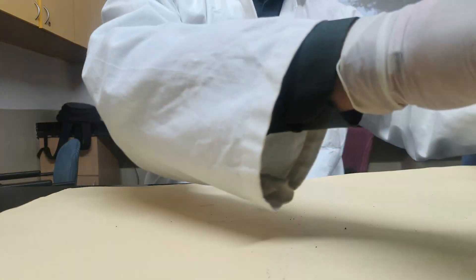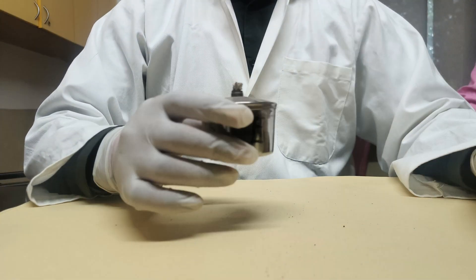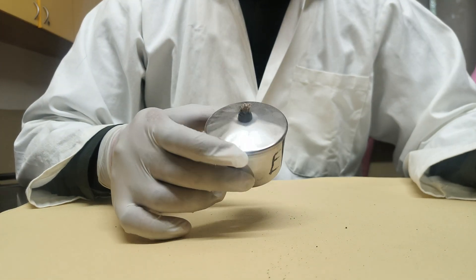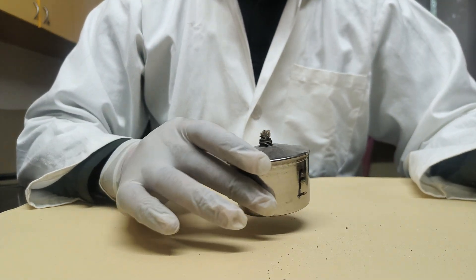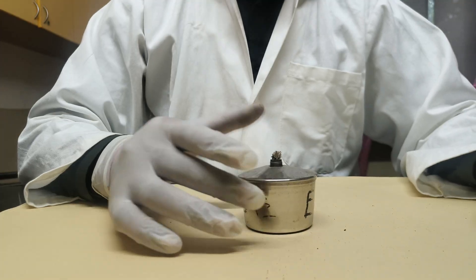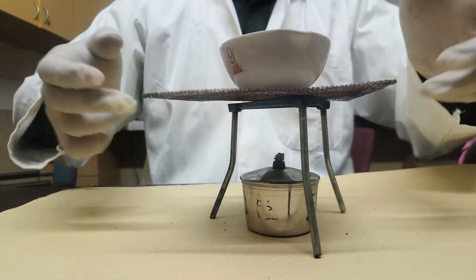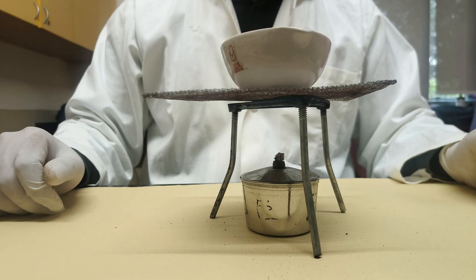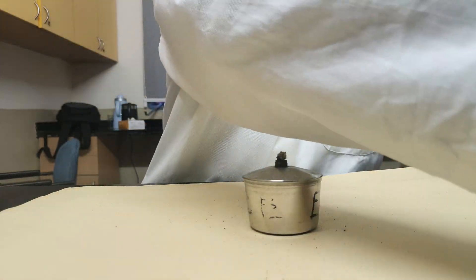Next is the spirit lamp. It is basically a heat source. It contains a wick inside it and provides heat to the compound or substance whatever we are heating.